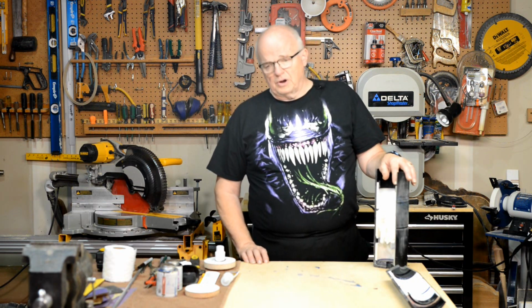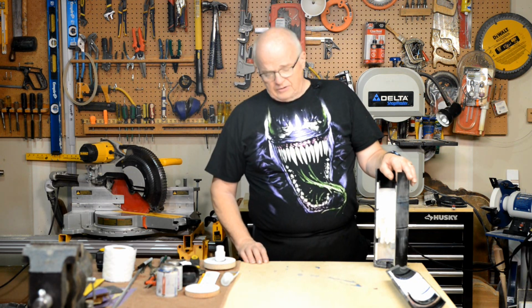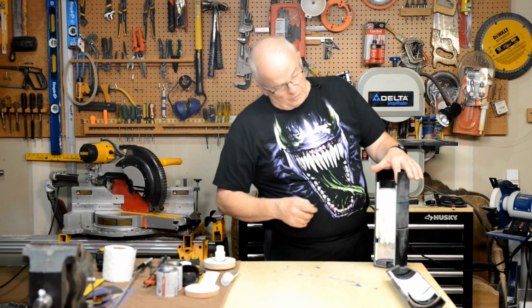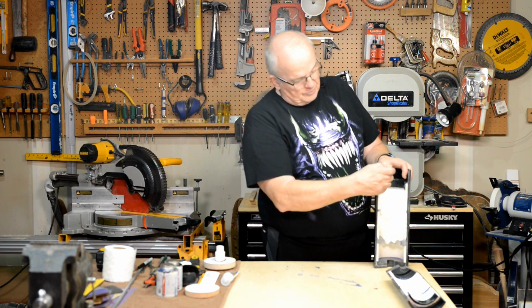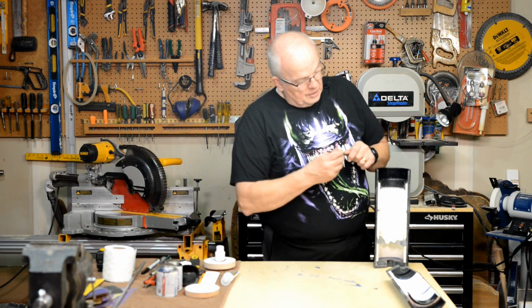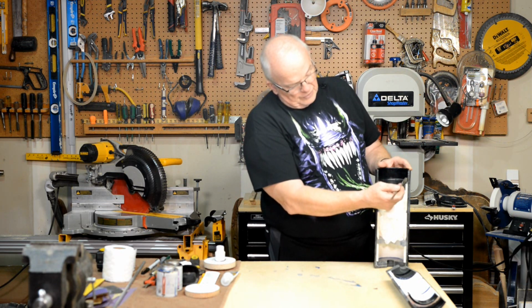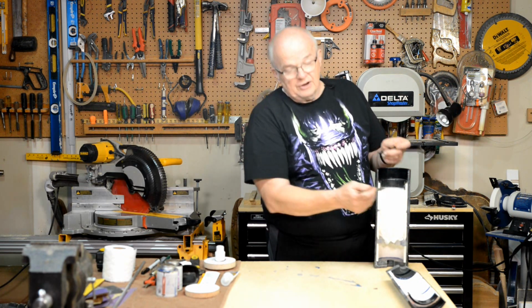I didn't know where it could possibly leak, so I searched and I found that it was leaking underneath this O-ring that was down in the channel. The air was coming down the outside, past the cap that was in there, going underneath that O-ring and up the other side, and that's where it was leaking.